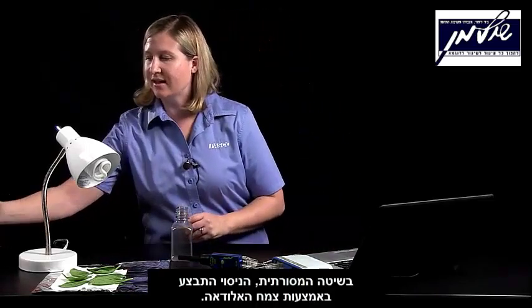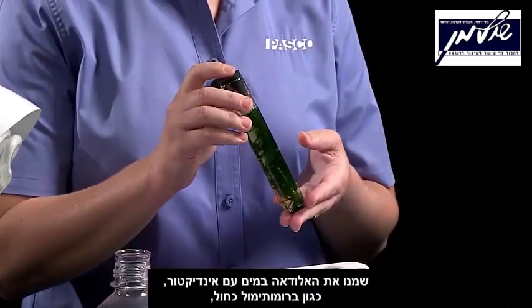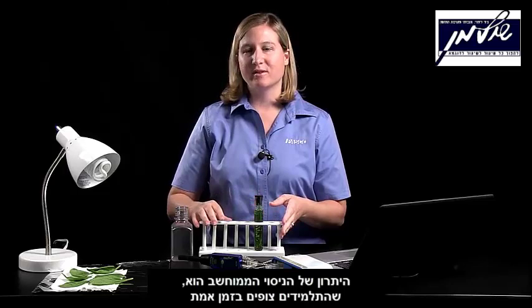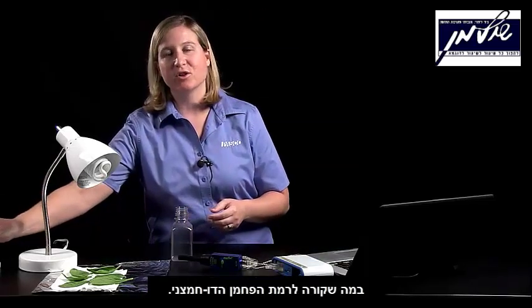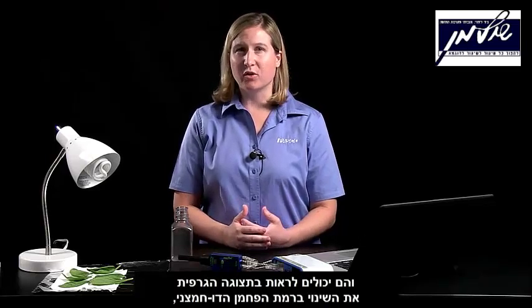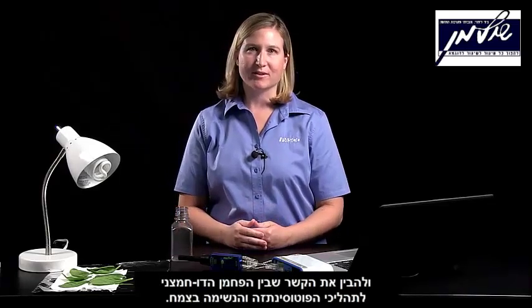Traditionally, labs might be done with elodea — putting elodea in water with an indicator like bromothymol blue and waiting 24 hours to see results. The advantage of this lab is it helps students visualize what's happening directly to the carbon dioxide levels. They can see it in a matter of seconds to minutes, and they can see on a graph display the actual change in carbon dioxide, helping them relate it directly to the processes of photosynthesis and respiration.